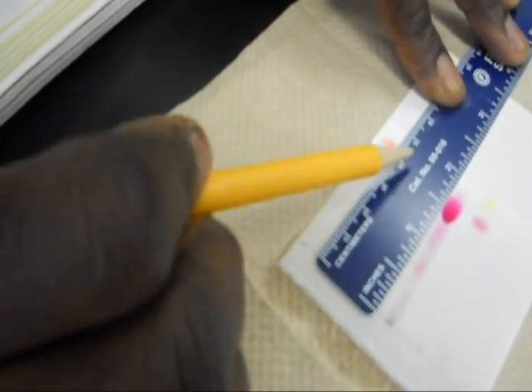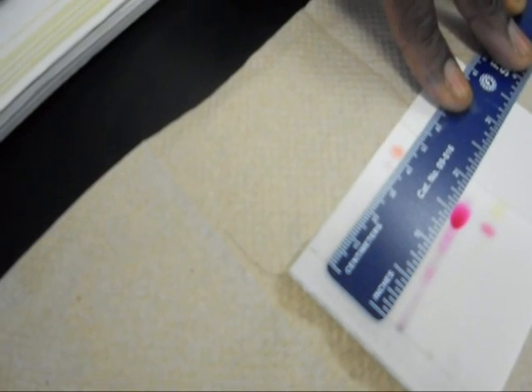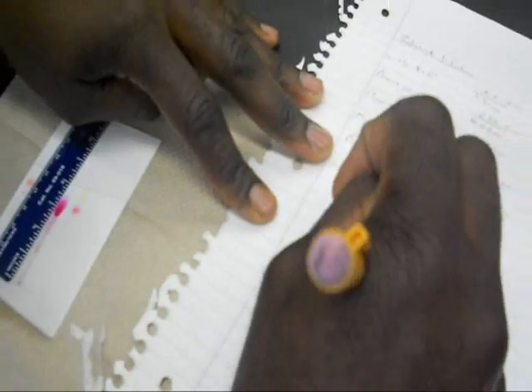Right there's the distance, which is 4.5 and take half of 4.5. And that's going to give us 2.25.